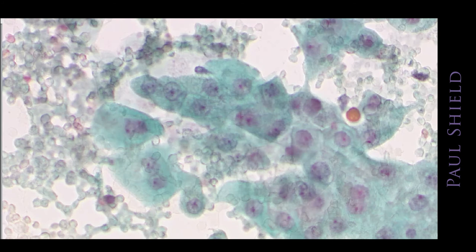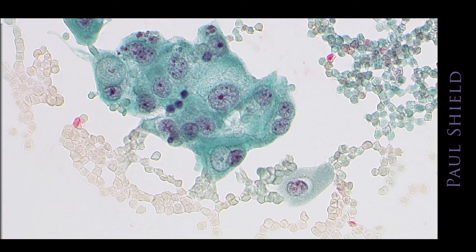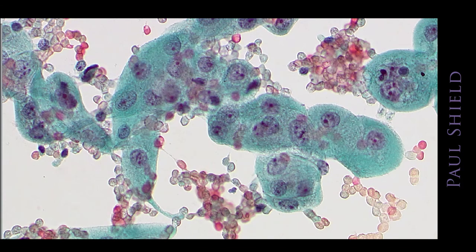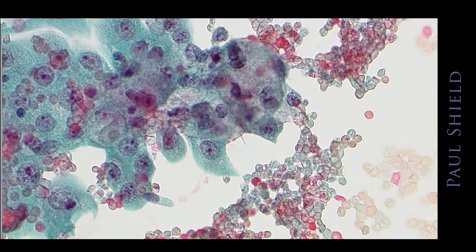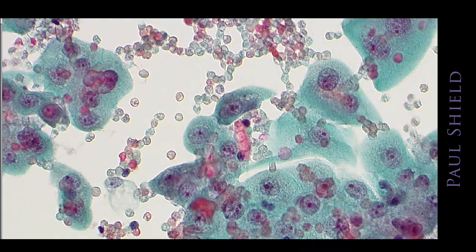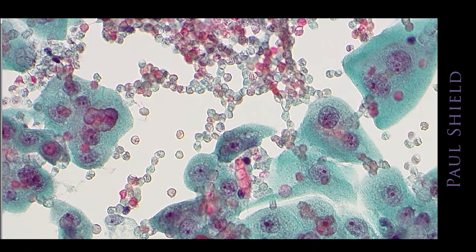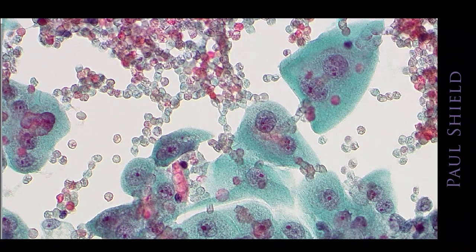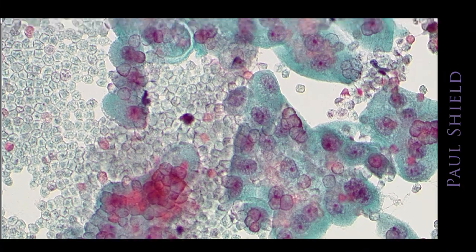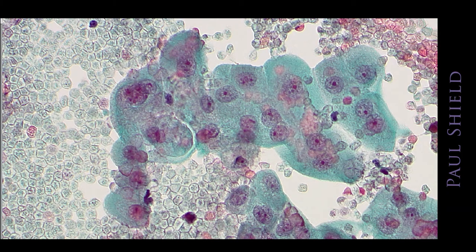This is quite a cellular and slightly reactive case. So cells here are a little more cohesive. Notice that the nucleoli are quite prominent, but chromatin is still fine and even in these. No really high NC ratios. So the NC ratio of urothelial cells depends on what level of the epithelium they have been sampled from. You'll notice there's a mixture here from larger urothelial cells that are bi and multinucleate down to smaller ones about the size of a squamous metaplastic cell in terms of NC ratio.